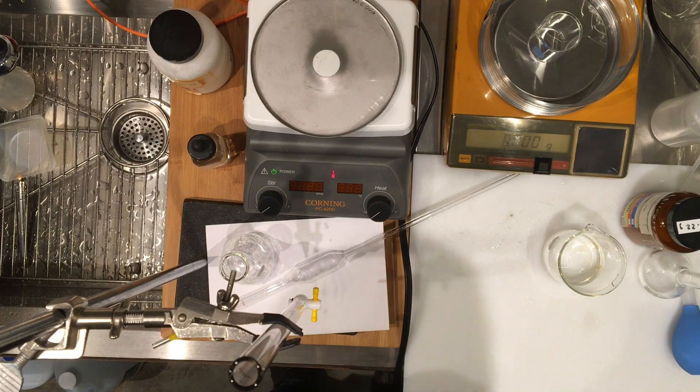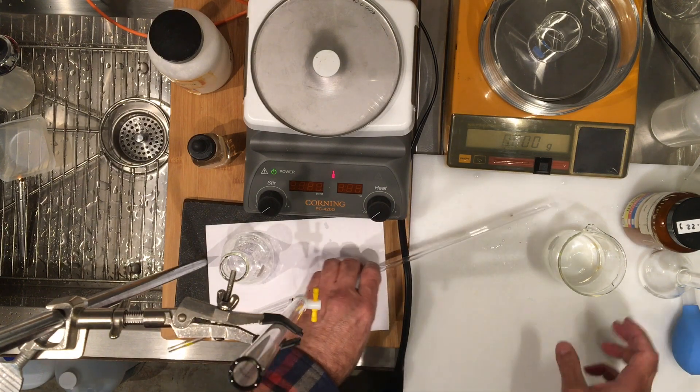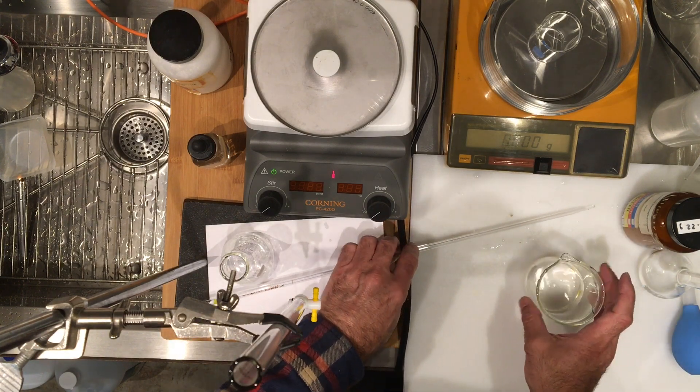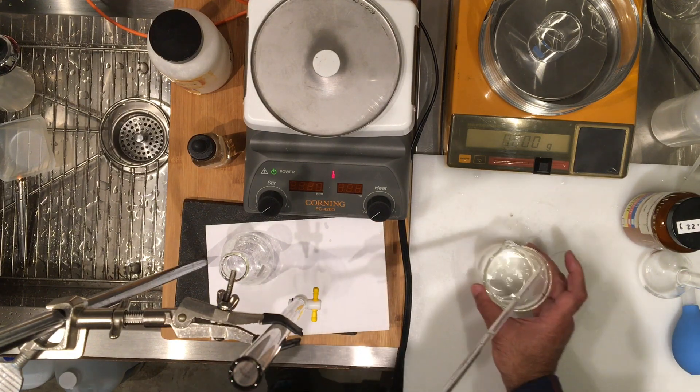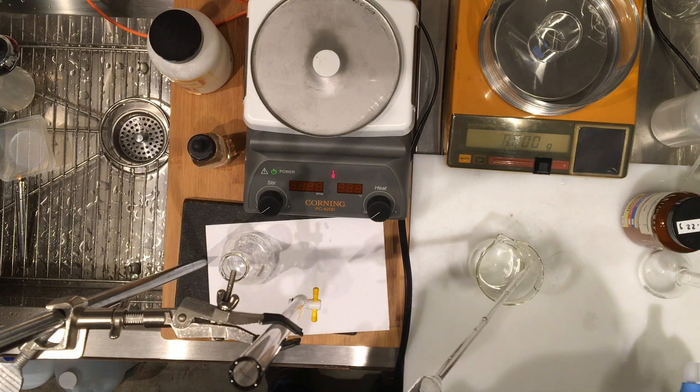Because I'm going to have us determine the percentage by mass, we do need to have a density value for this vinegar. It's probably close to the density of water, but we'll determine it more exactly.